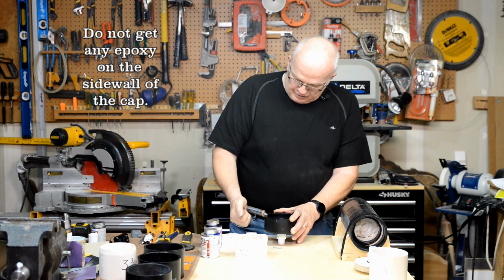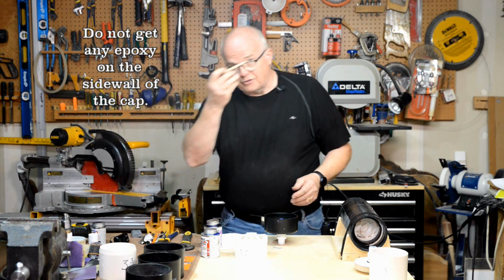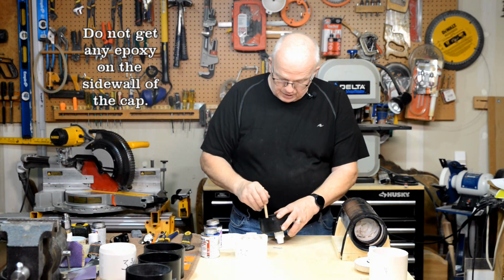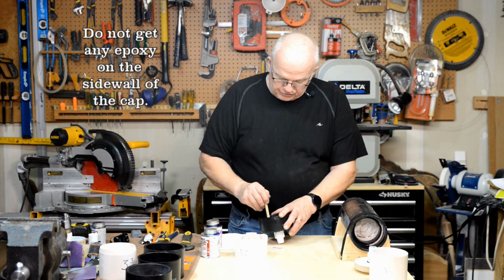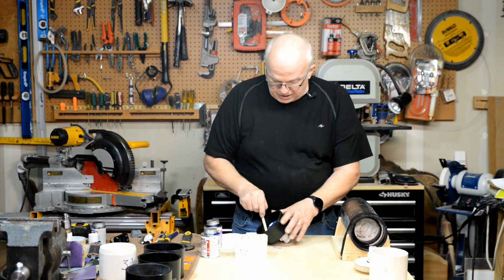And then again, I've run out of chopsticks, so I've got a little piece of oak here. But I'm going to start to mix that around. Now you've got to be careful. I mean, you've got to be quick with this. Push it up against that edge.